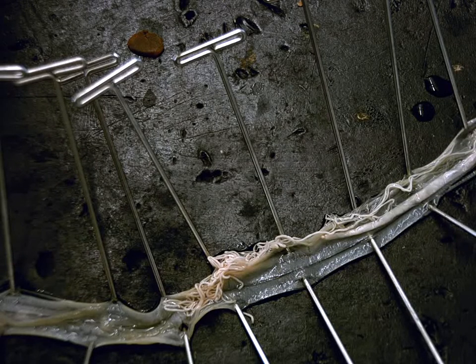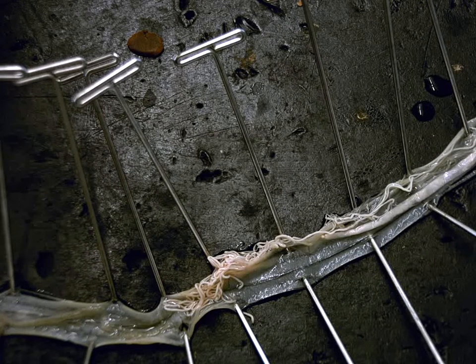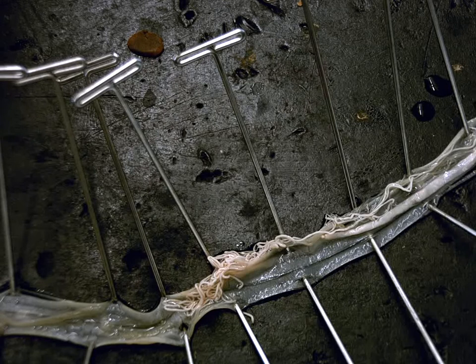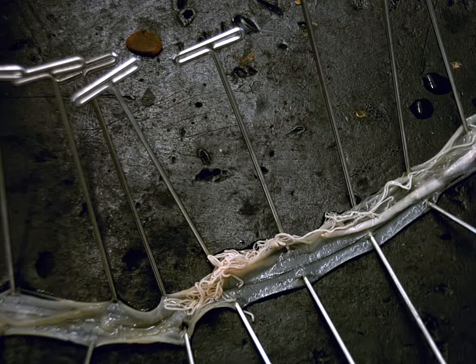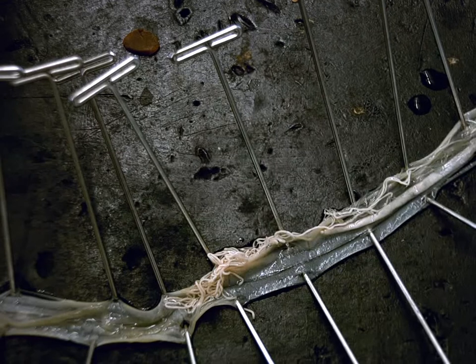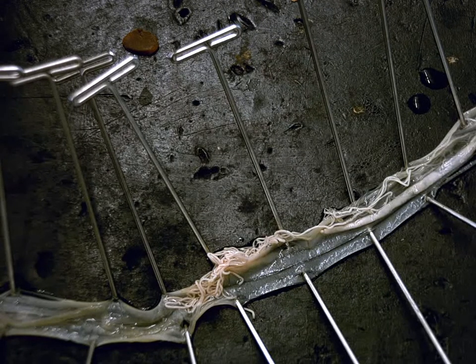So what we have is a super thin one, and we actually will identify them by size. So the extremely thin one, which is down here at the posterior end where my probe is poking, these super skinny ones would be the testes.